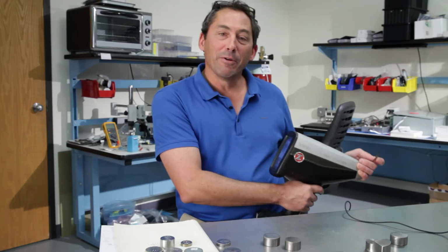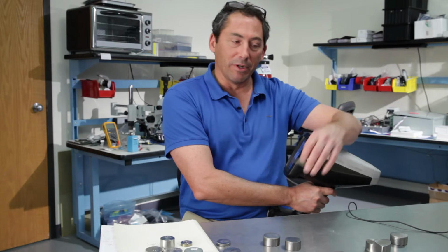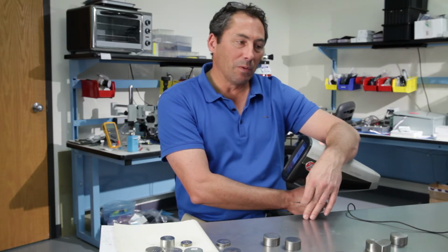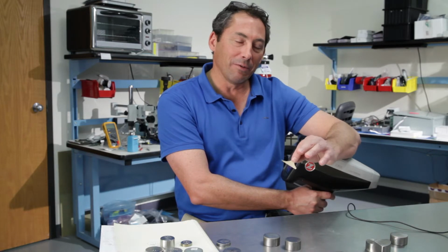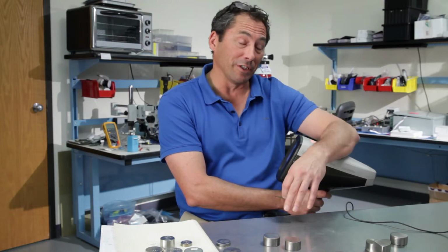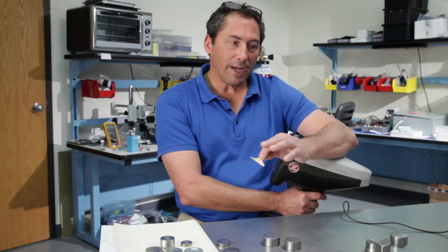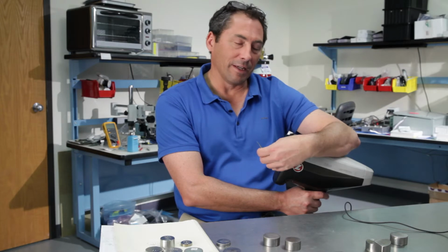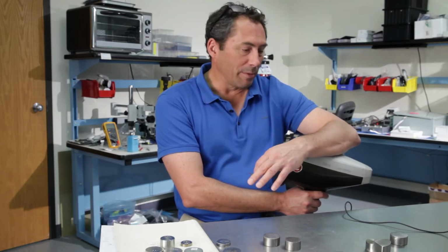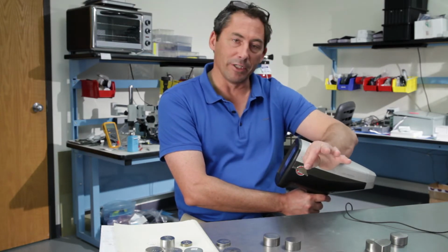Okay, the last thing I want to show is this app that we call Element Pro. We include it with every analyzer we ship. And what I love about this app, and about LIBS technology in general, is that I can shoot anything, and in 5 seconds this analyzer will do a scan of the entire periodic table. It'll show me all the elements it's found in whatever I'm shooting, without having any calibrations.